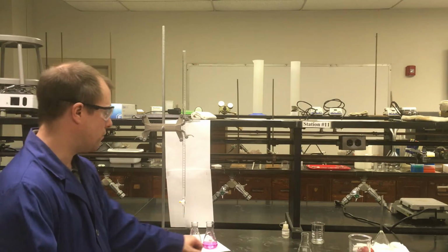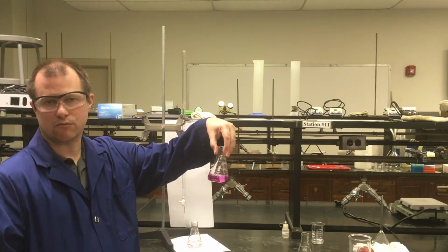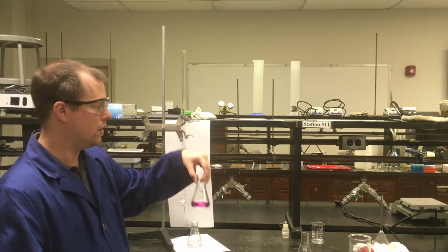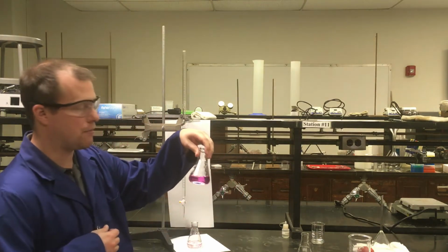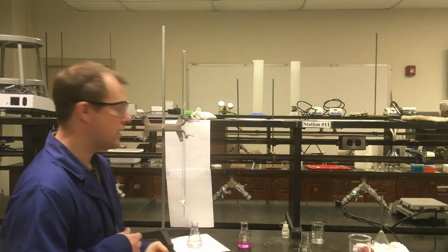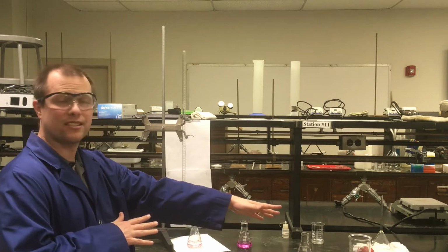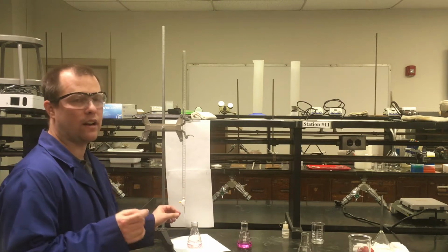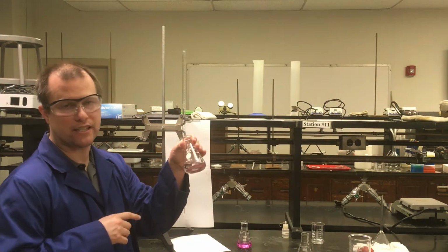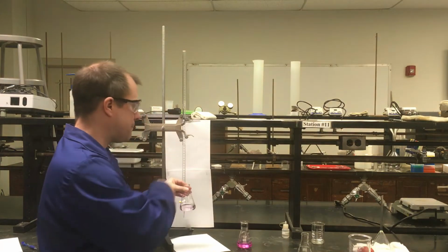So this solution that you see right here is a solution that's relatively basic, probably farther than we would ever want our titrations to get to. So if this is a pH that might be somewhere like 8 or 9 or higher, even closer to maybe 10 or 11, if we want to get a really accurate measurement of the moles of acid that are in our starting solution, we actually want to aim for ending our titration when we have just a really, really faint pink color. And when I hold it over here, it might even look clear.